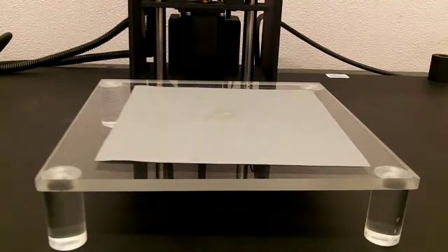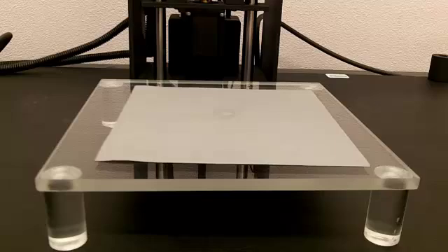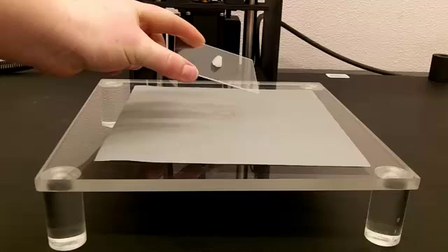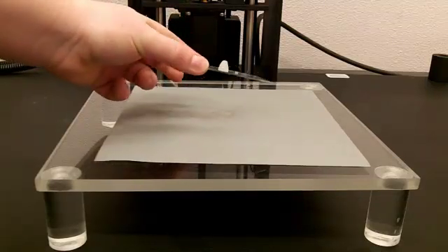The next type of shot is the ventral shot. For this, the type of stand that we use is a glass slide with a glob of wax set up like so.